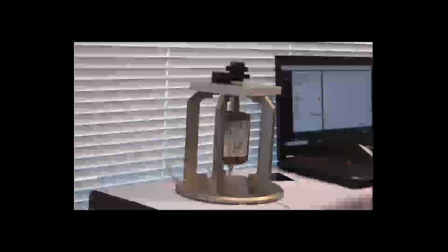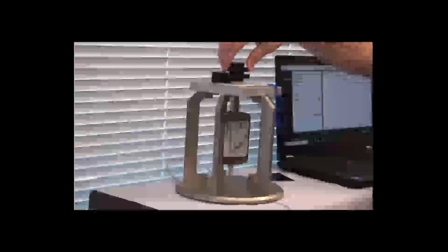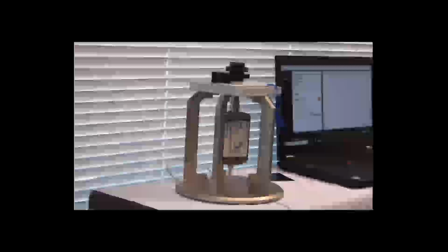And now we're going to calibrate by inserting our Teflon specimen into the device. So the Teflon goes in between the electrodes. There's a top knob, which we very gently tighten down until it's just snug. And then there's this loose knob here, which we press and tighten. And this is a torque limiting knob that allows us to give consistent torque or pressure on our specimen.